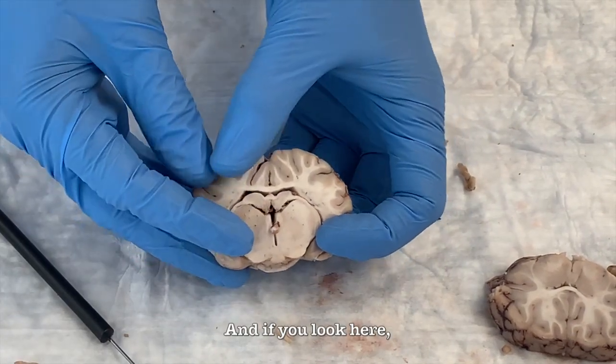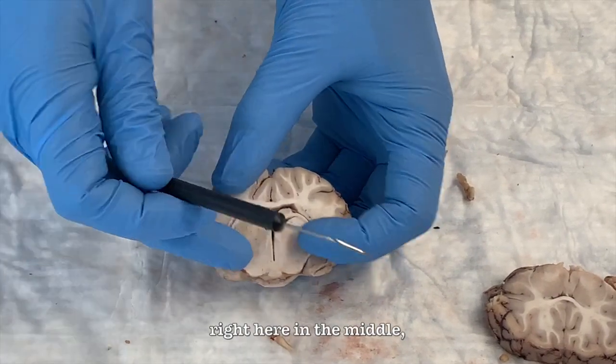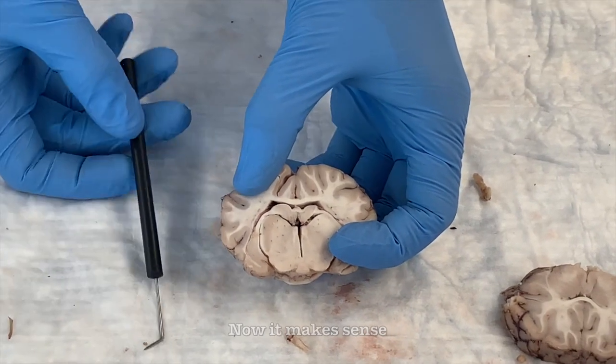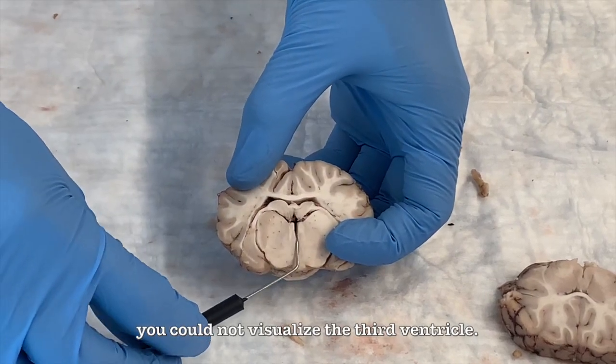And if you look here, you see there's the thalamus, and right here in the middle you see the third ventricle. And now it makes sense why when you did a sagittal cut you could not visualize the third ventricle.